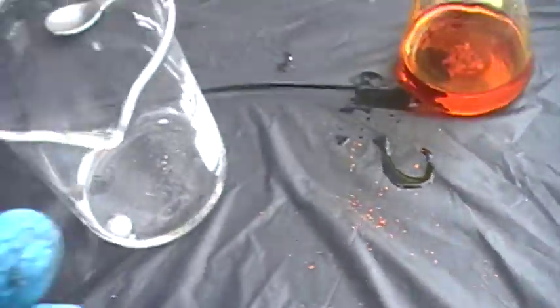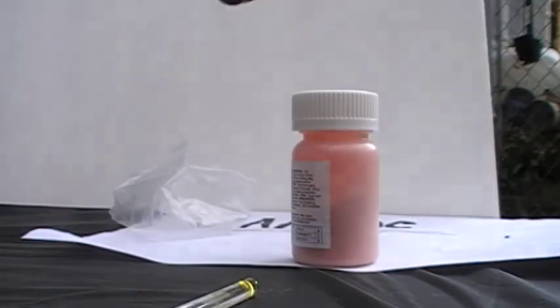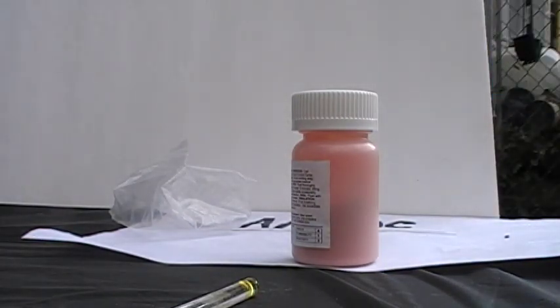Just a second — let me wash my hands. That's some sulfuric acid on me, I don't like that. So yeah, that's why you always want gloves on, because it will burn you. Didn't burn me though. I forgot a dropper, so I just ran and got it.